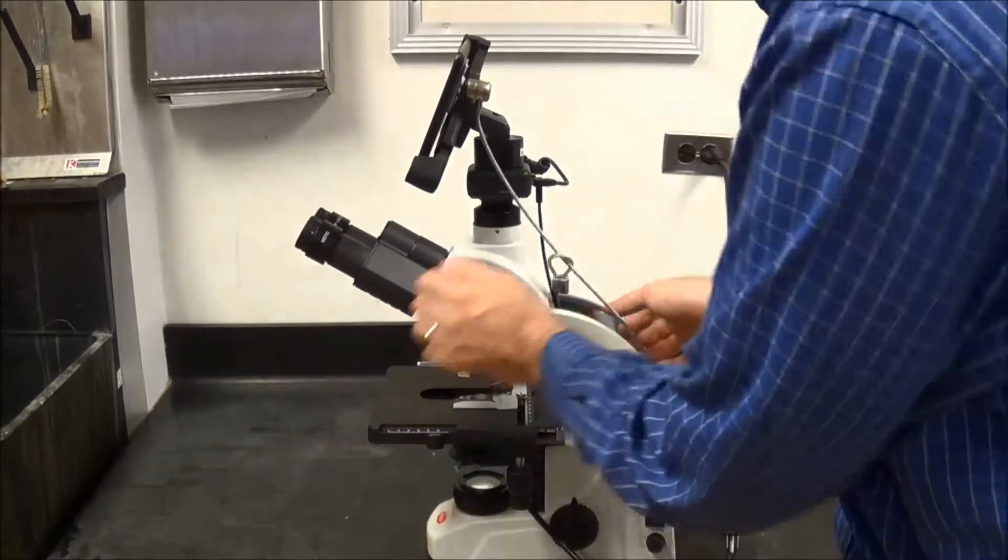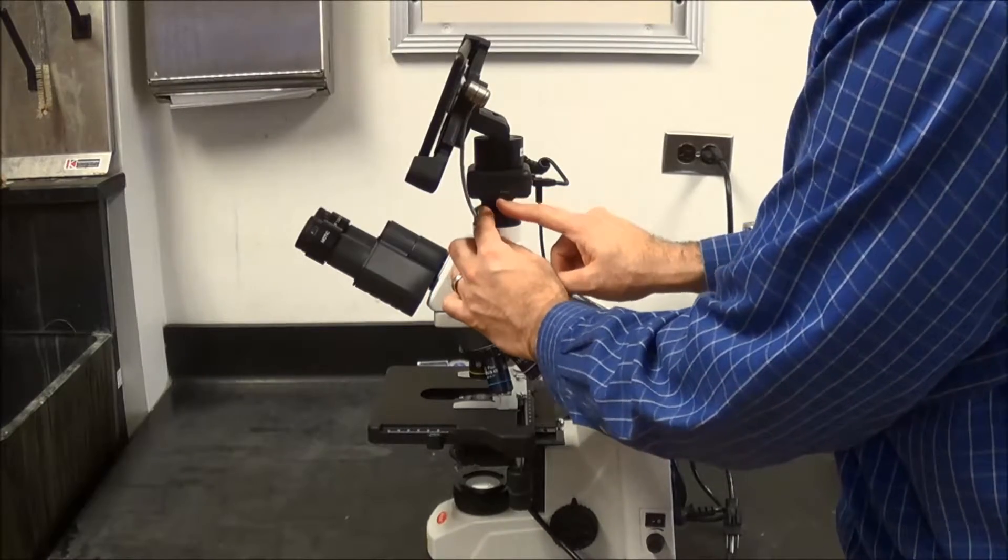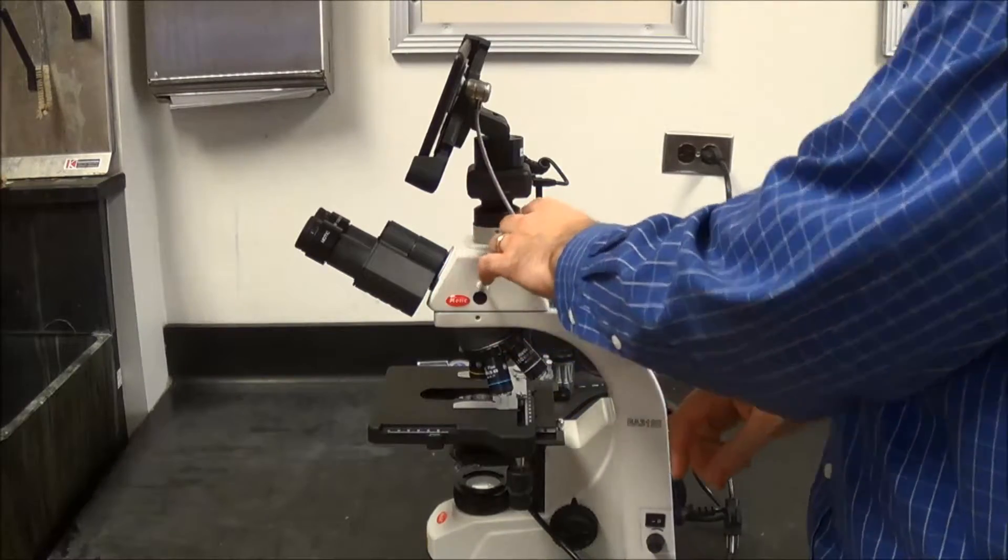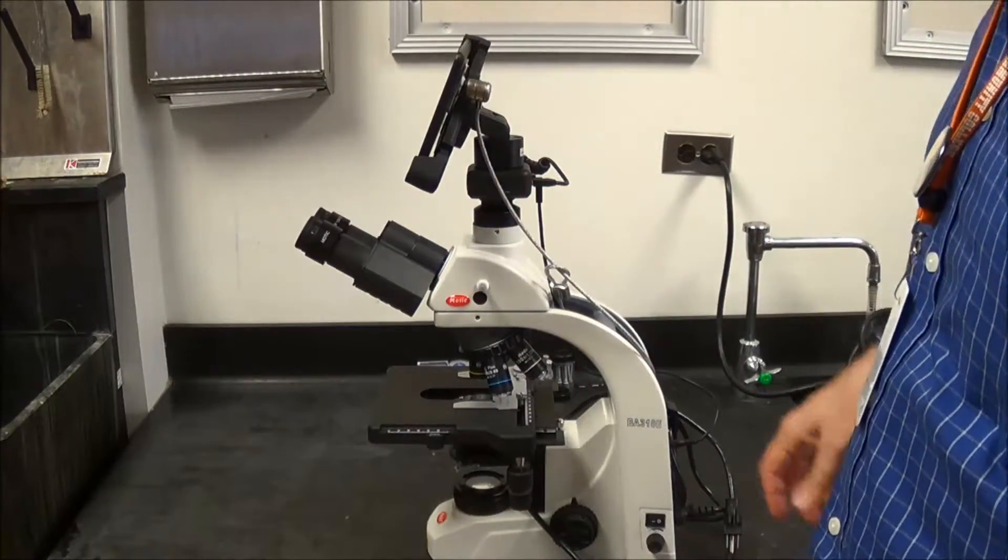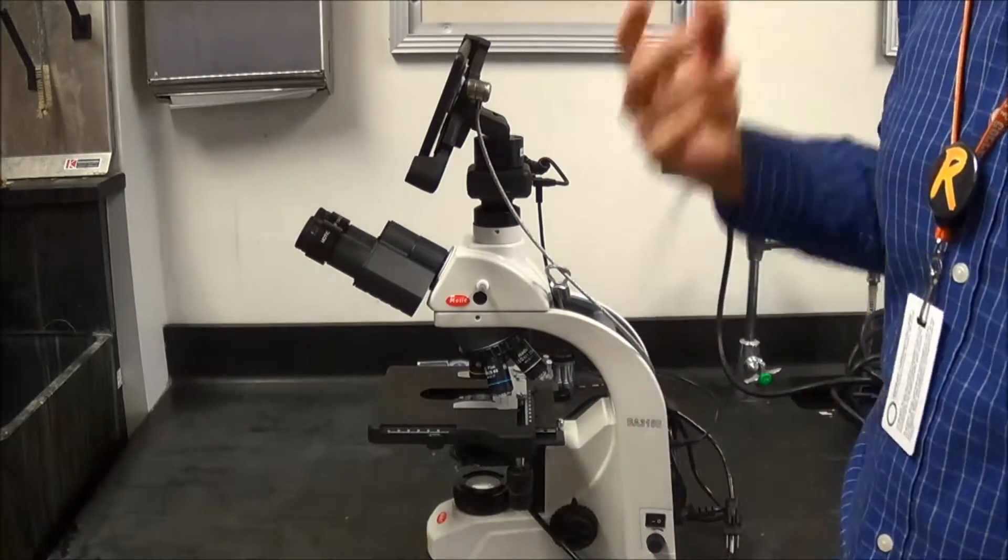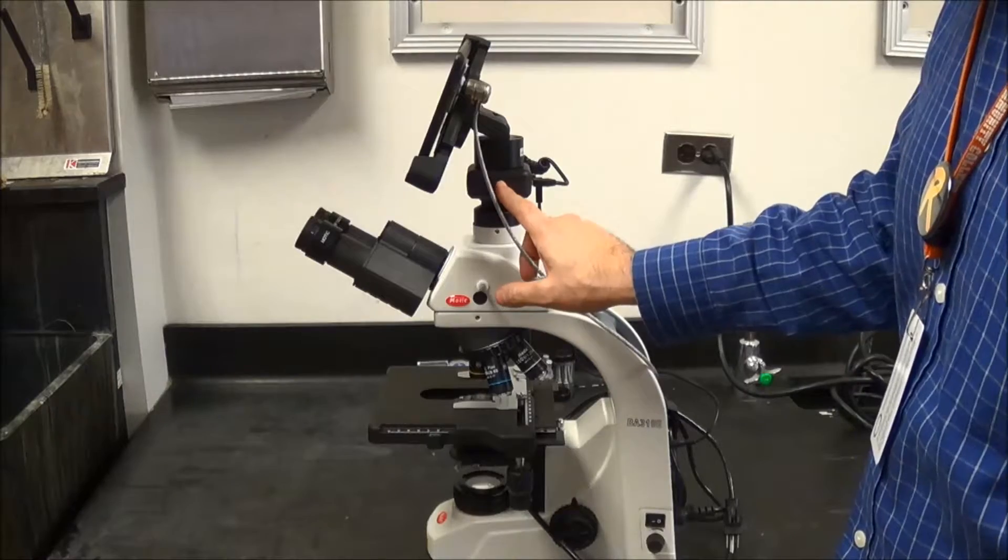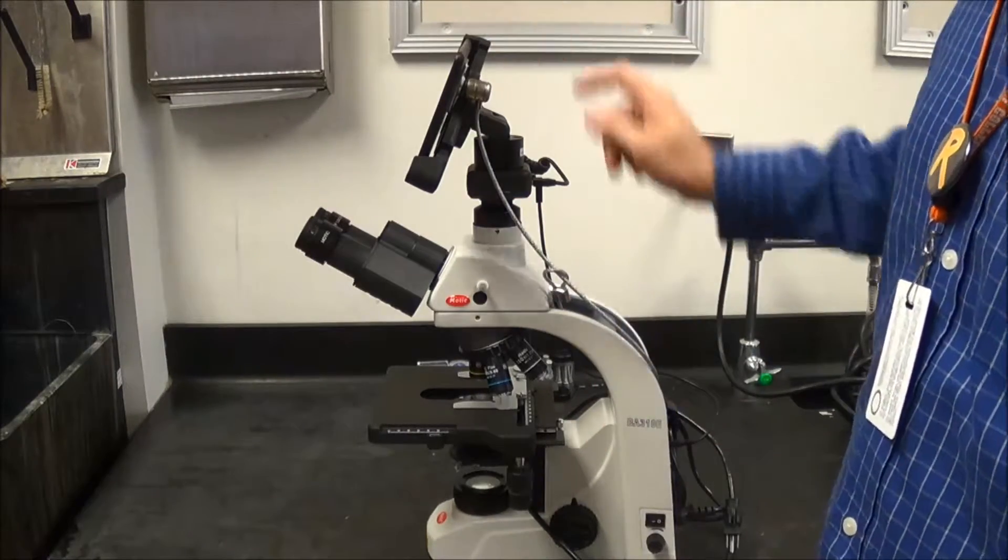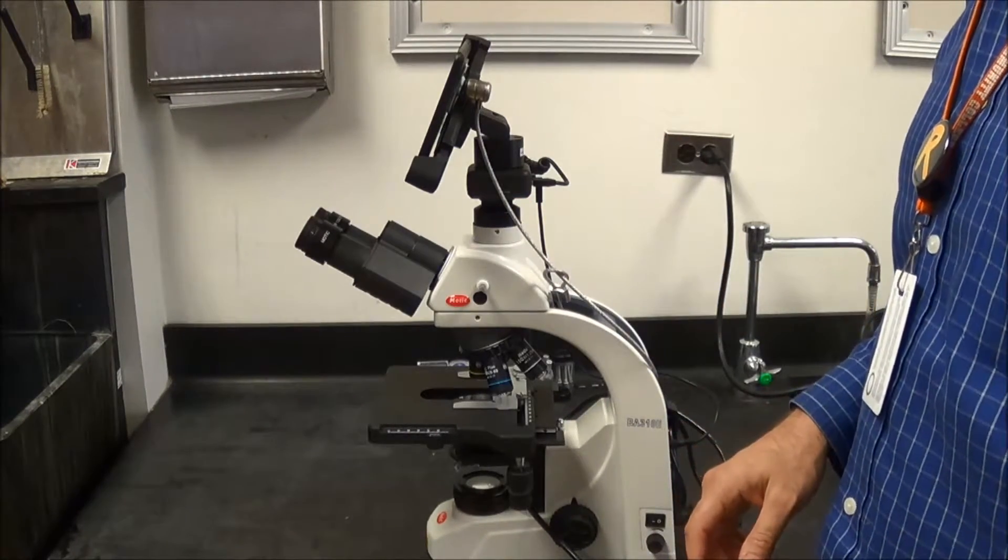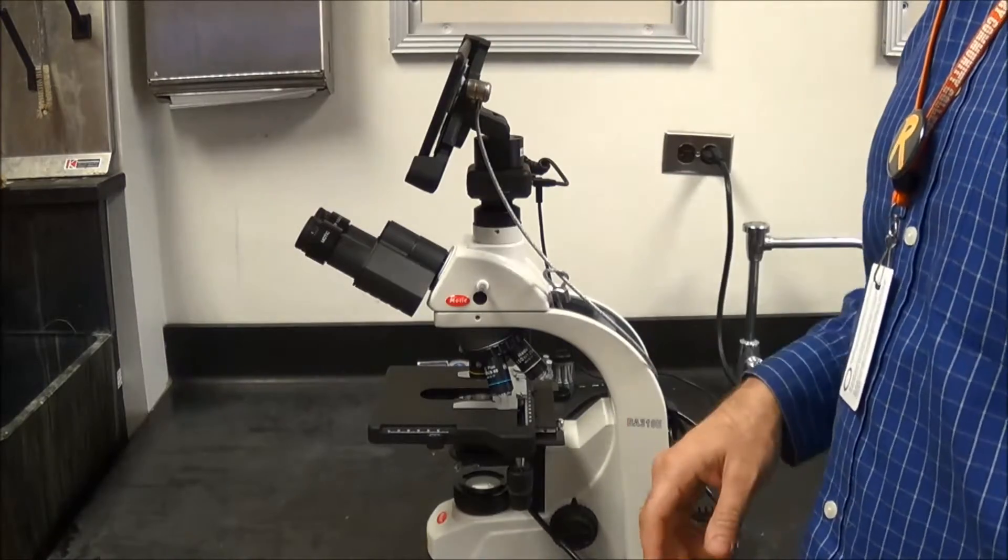Also, please remind them to put the microscope back to USB. If they've been using their cell phone or their tablet and grabbing images that way, that's great. We want them to use it. But we also want this to be back in USB mode so that the next student who uses this, when they turn the tablet on, will be able to get the images right away.